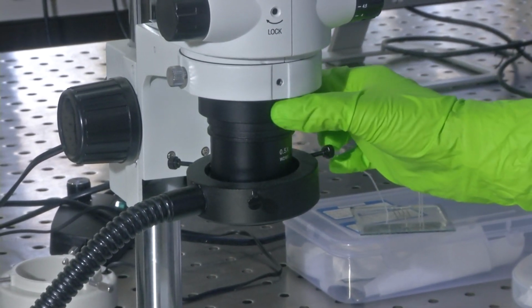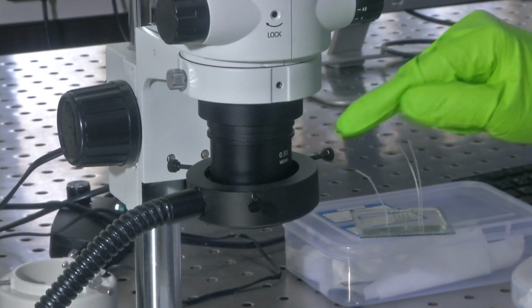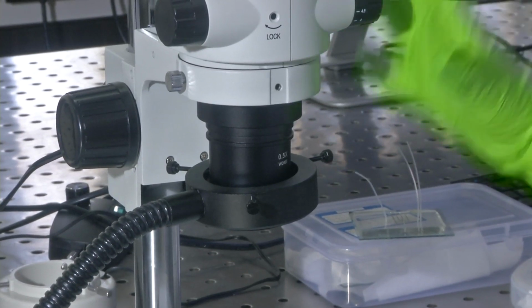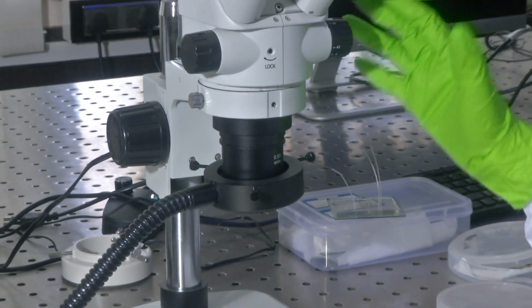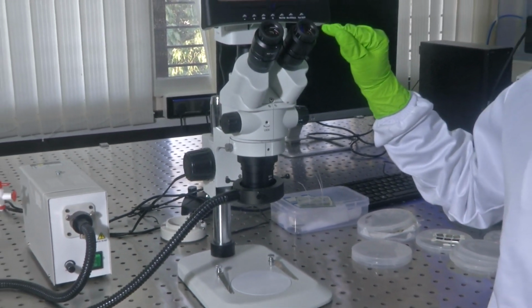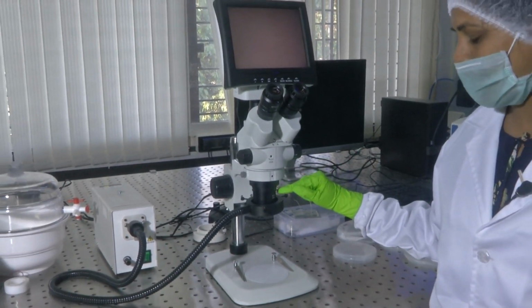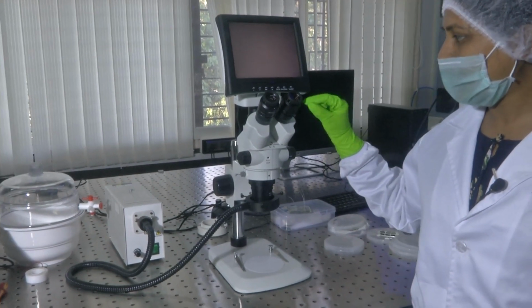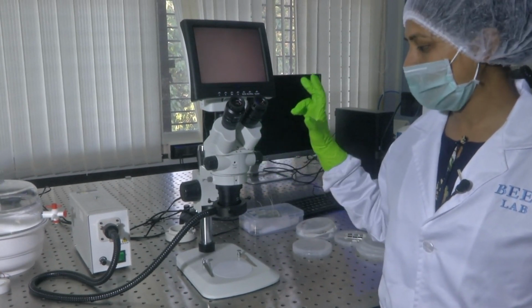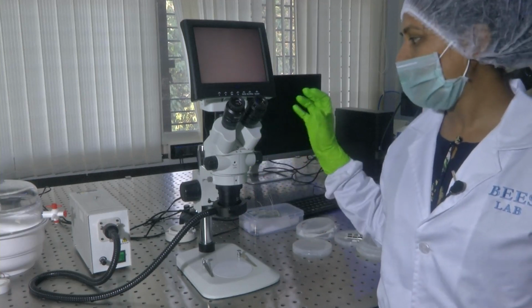Turret is also called the rotatable nose piece, which could be used to increase the magnification power of the objective. So, let us see what the magnification power of a microscope is. One thing you have to remember is that the eyepiece lens has some power and the objective lens also has some power. When you multiply the power of the eyepiece with the objective lens power, the result is the entire magnification that your microscope can provide.